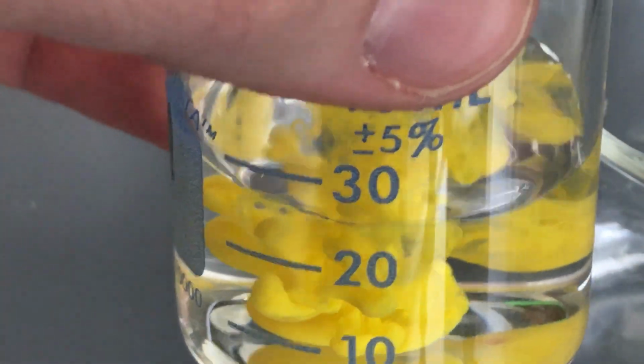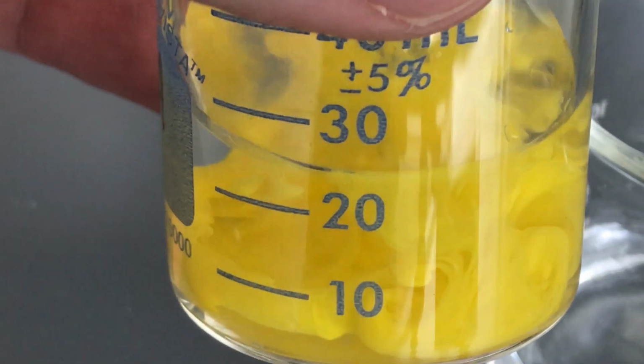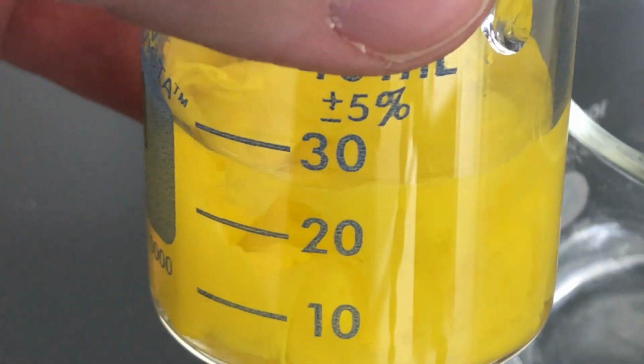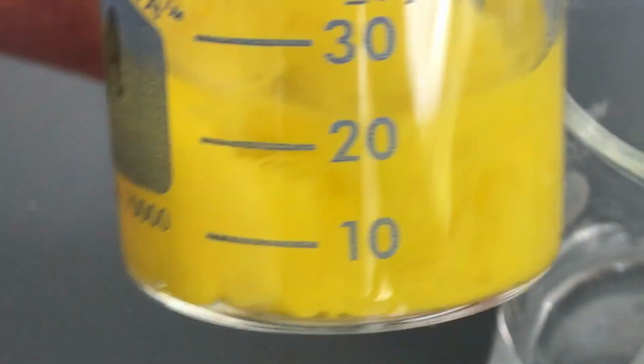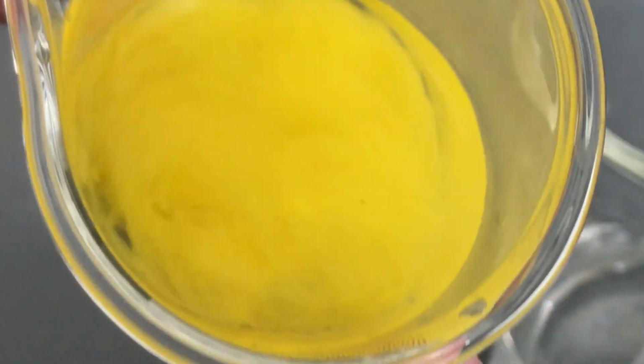boom, we now have the magic. We have the creation of lead iodide, because I've taken the lead from one and I've reacted it with the iodine from another. And so you can just see it's kind of murky and kind of like a solid in there. Not kind of like, it actually is. It's known as a precipitate. So it's a solid material that forms when two liquids have ions in solution.